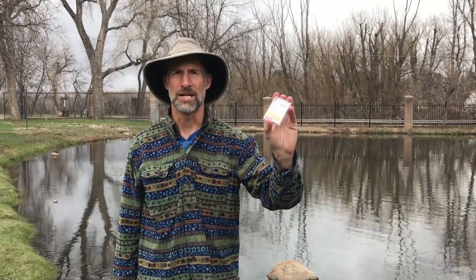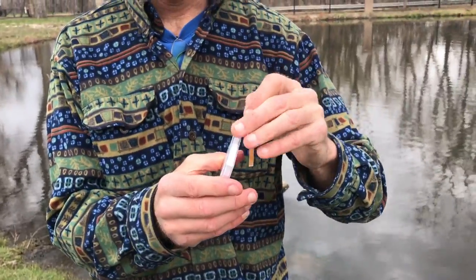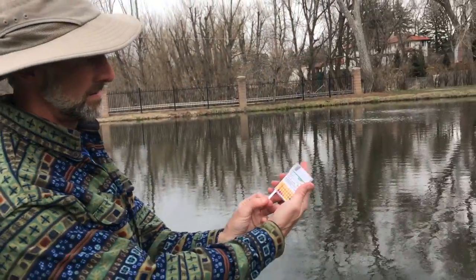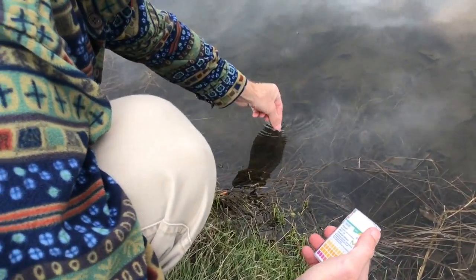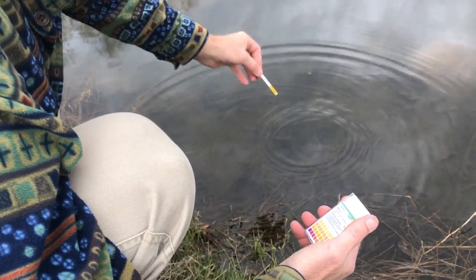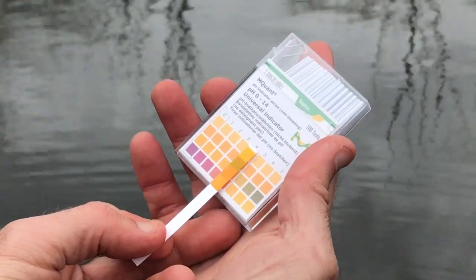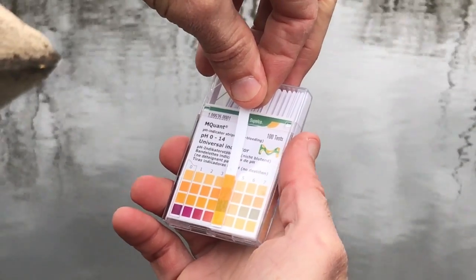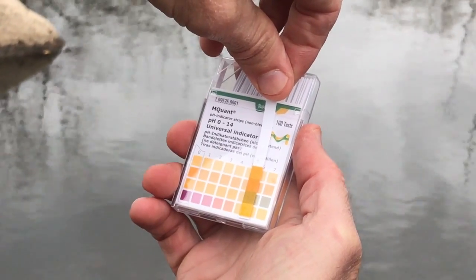Last but not least is our pH test of acidity of the water. So this is the easiest test of all, I believe. It's just a simple test strip. So we will dip it in and compare it here. And we dip in for just a couple seconds. Shake it off, and let's see where we're at here. It looks to me like we might be, actually it's like this. It's a little bit higher than a 5, a little bit less than a 6. It looks to me like about a 5.5 for our pH.